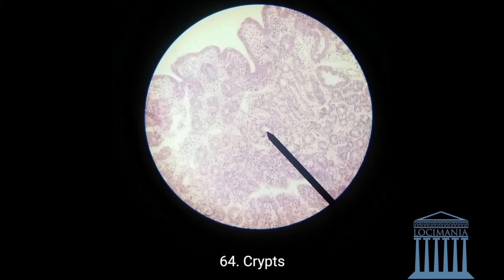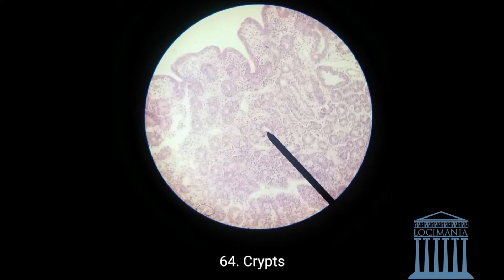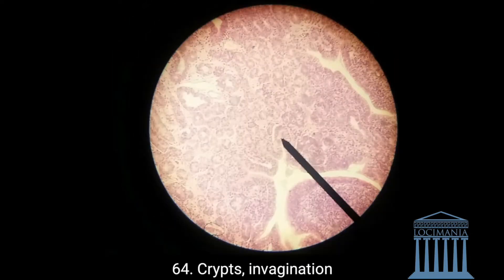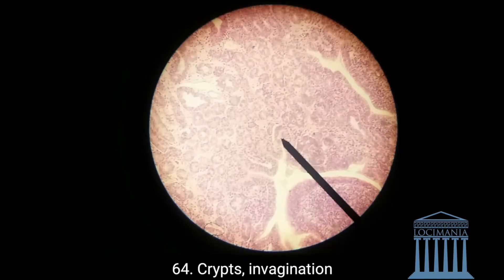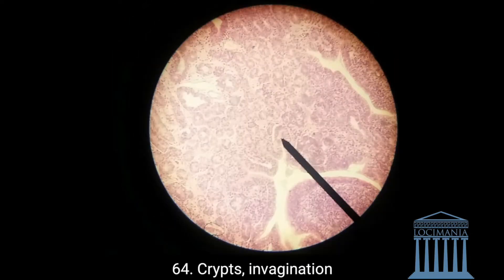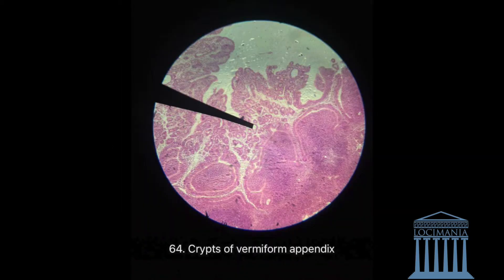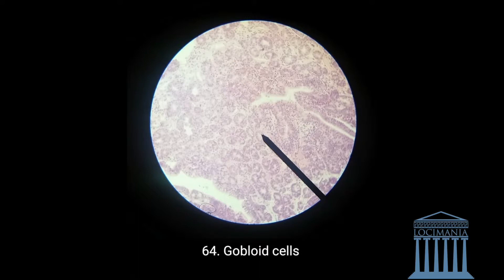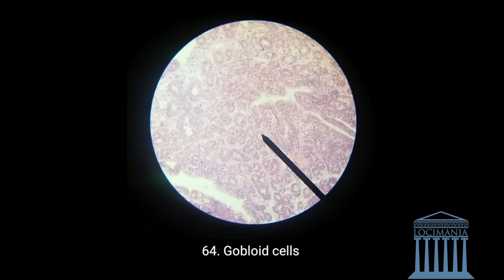The first detail I'd like to show you are the crypts with invaginations. Here we have the crypts with invaginations. I'd also like to show you the goblet cells — we have large amounts of goblet cells in the appendix, so they are abundant.